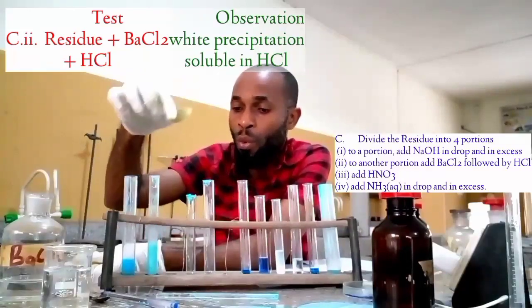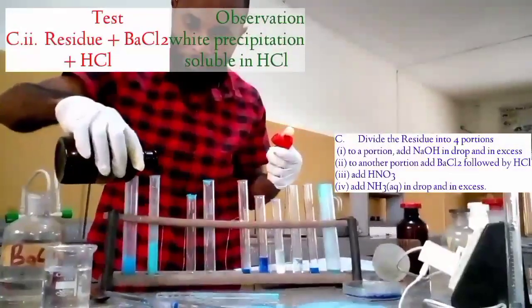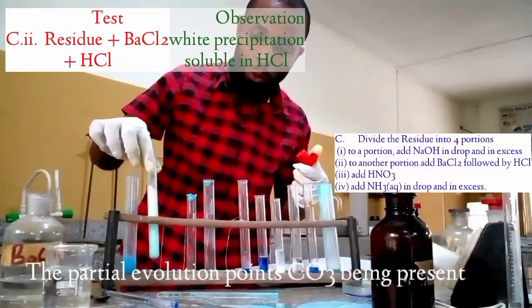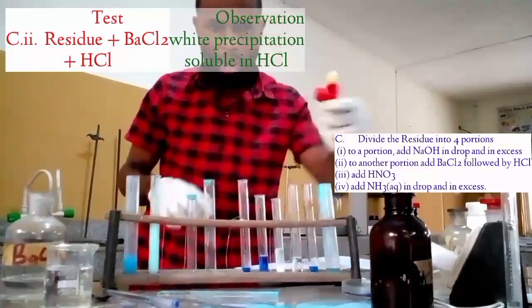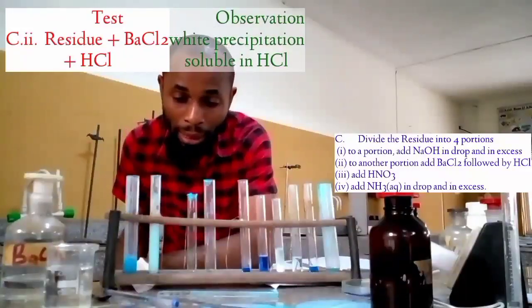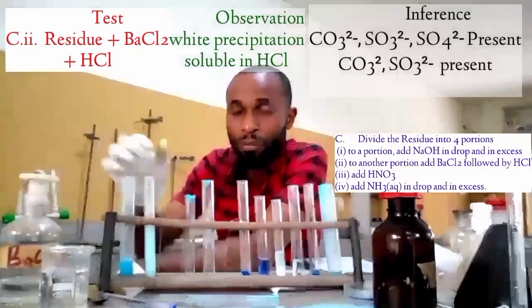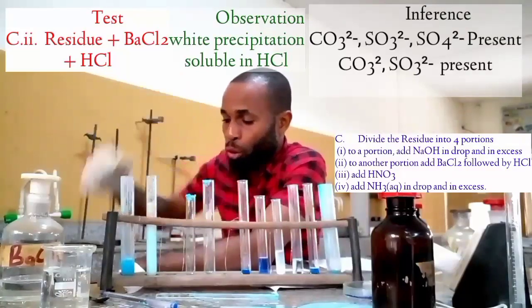Then the next thing they ask you to add here is hydrochloric acid. Let's add the hydrochloric acid. You see, there is evolution of gas when I added the hydrochloric acid. And when you add hydrochloric acid and you are having evolution of gas, this points that there is CO3 2 minus present here.